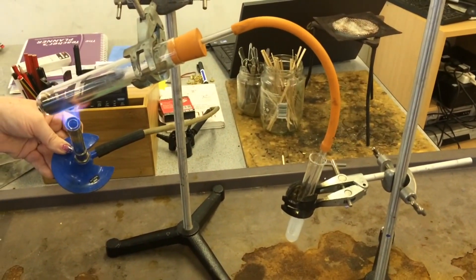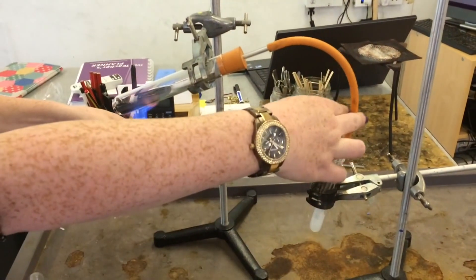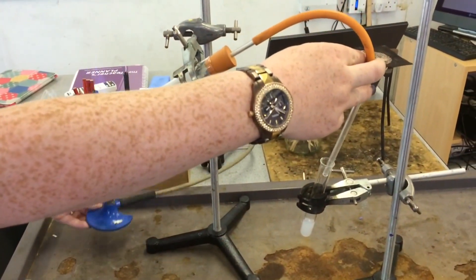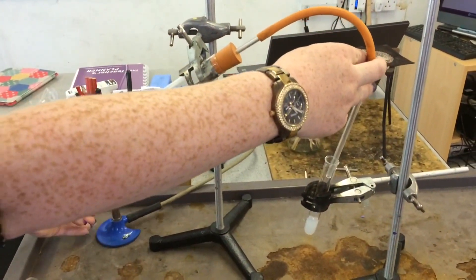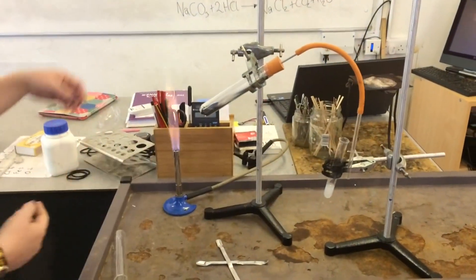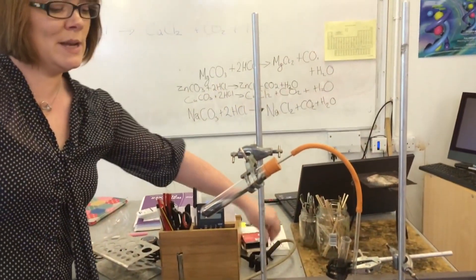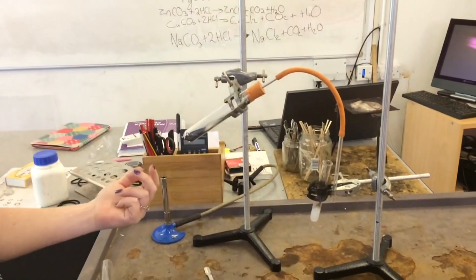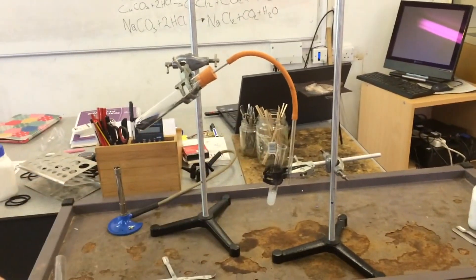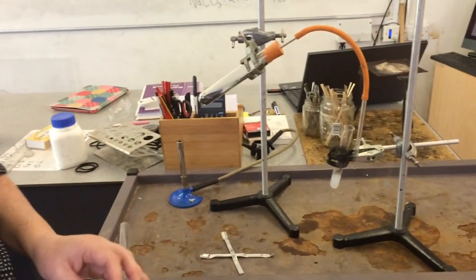The really important thing you need to remember is to take the tube out of the lime water first, and then remove the heat. If you're still heating it and you remove the heat but leave the tube inside the water, we're going to get a suck back happening, which could cause the tube to crack.